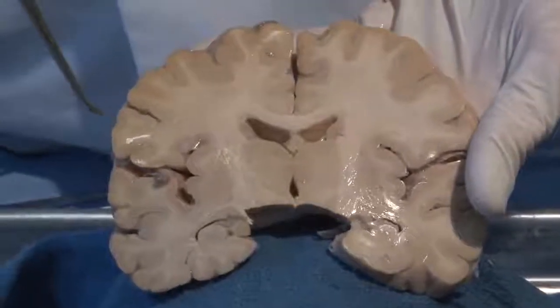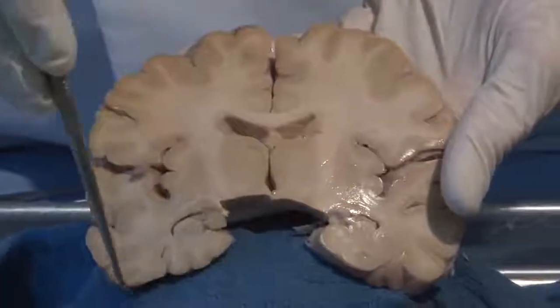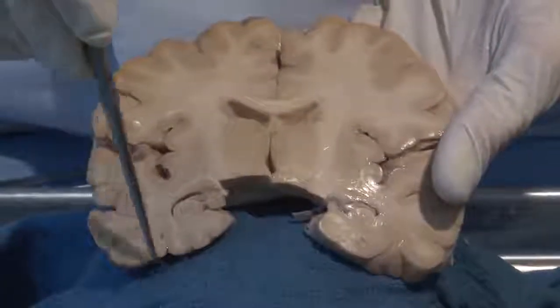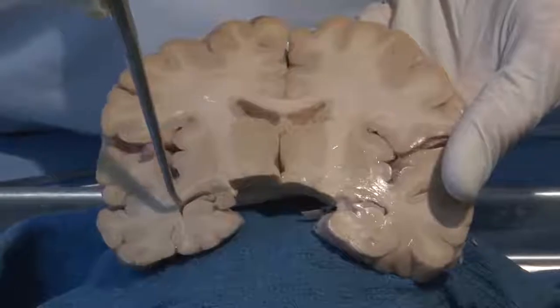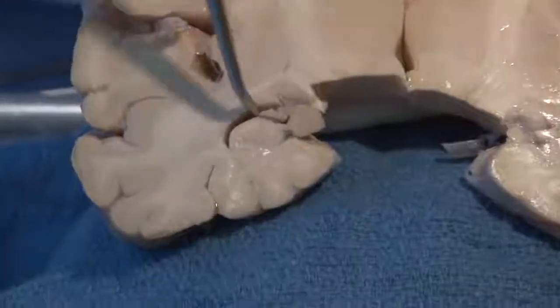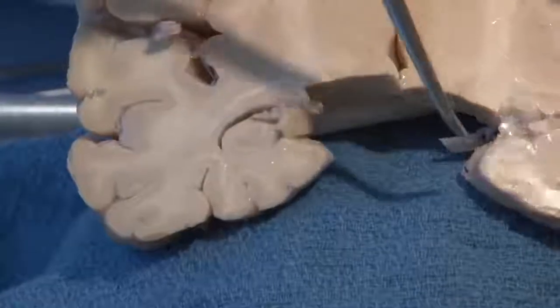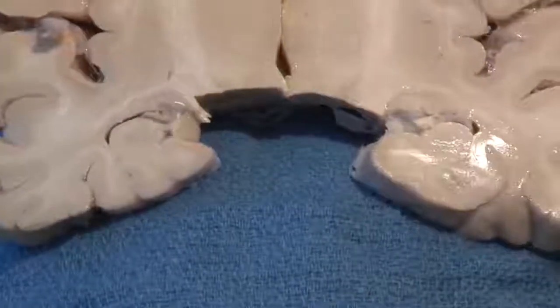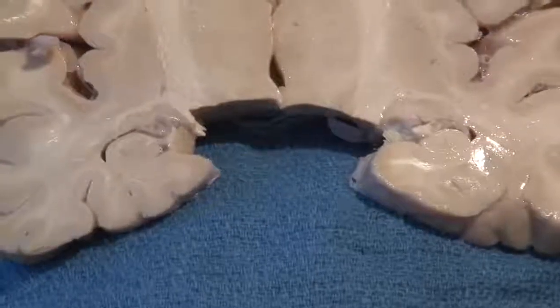It doesn't really matter. And remember, I told you that one of the functions of the temporal lobe, in addition to the auditory region, was an area involved in memory. That area is called the hippocampus, and it's curled up here right in this medial part of the temporal lobe. The other major structure you see in a cross-section like this, or a coronal section, are these holes in the brain.